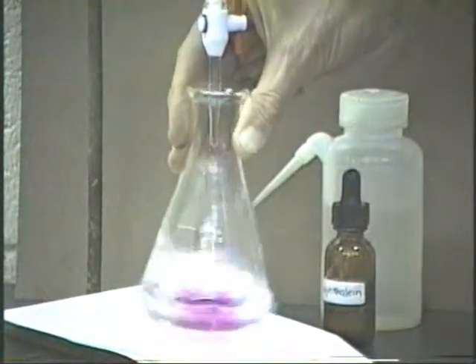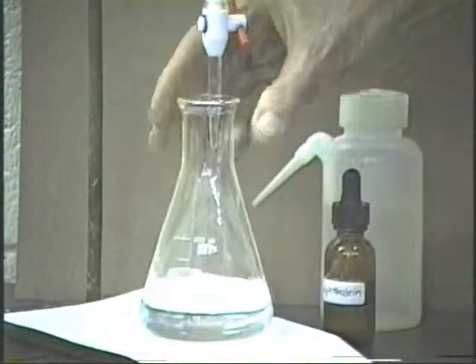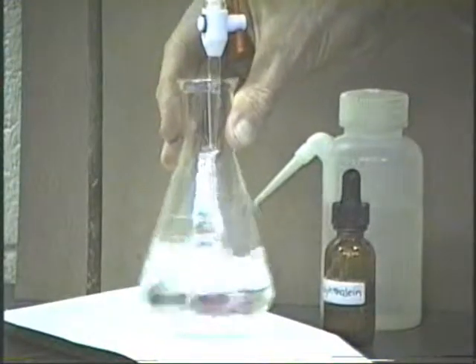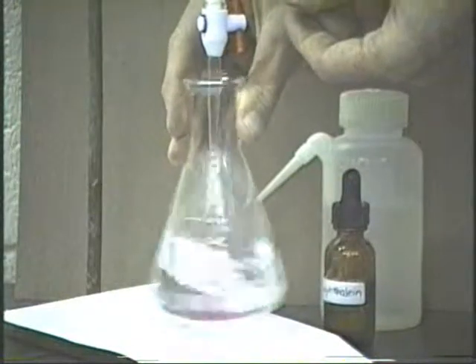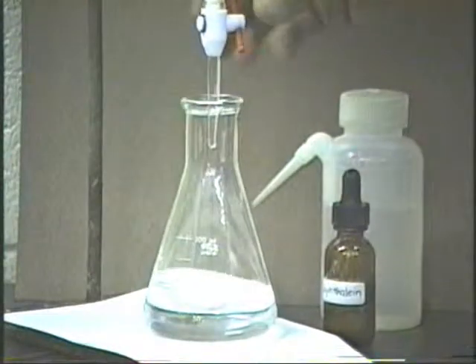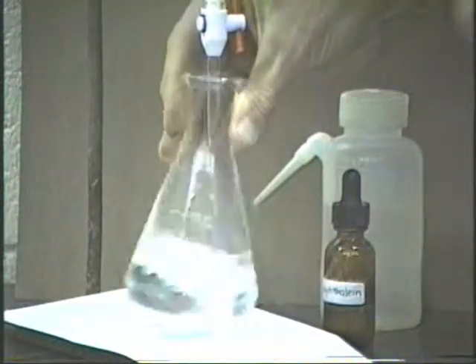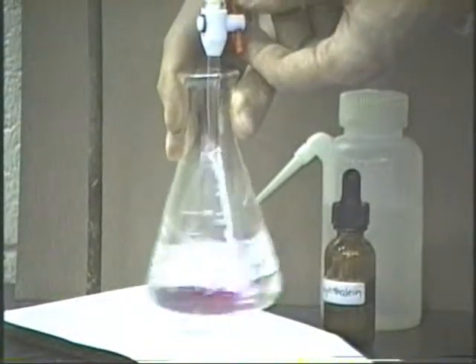Keep swirling, we can keep adding it at fairly rapid. Well, now it's getting pretty big, so I think we'll stop it. We're within a milliliter or so at the end point, and we'll now start adding dropwise. So, you see now, adding at the slower rate, the pink color isn't quite as, but now it's getting big again, so we'll go even more slowly. Just stop it and just get that going just barely. There's 1 drop, 2 drops, 3 drops, 4 drops, 5 drops.